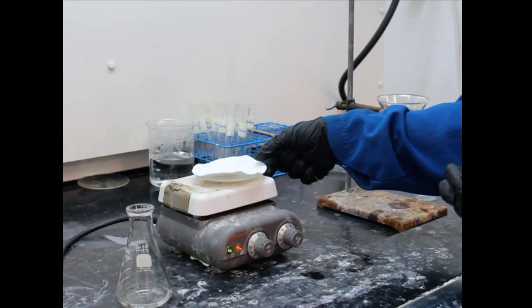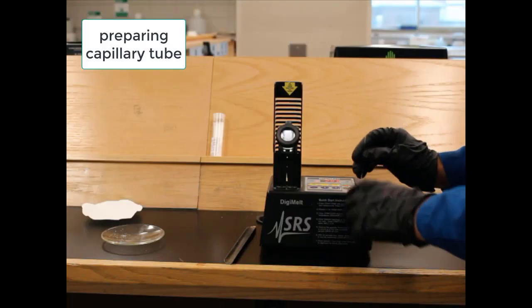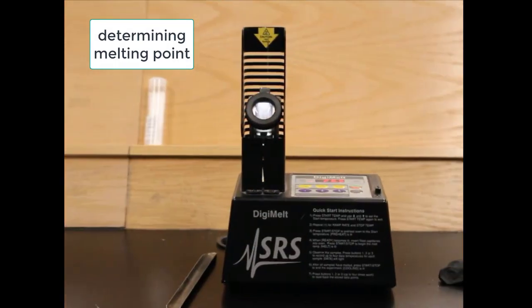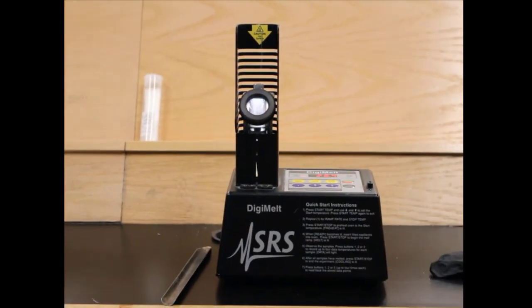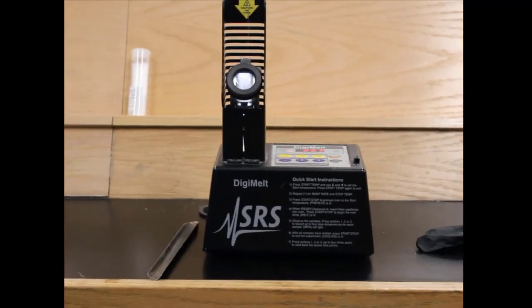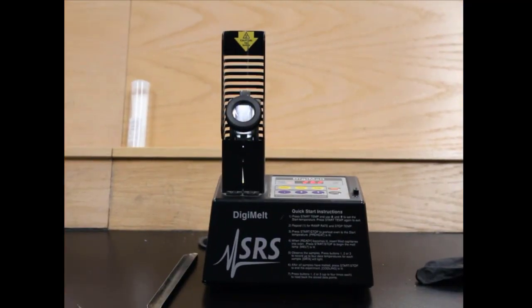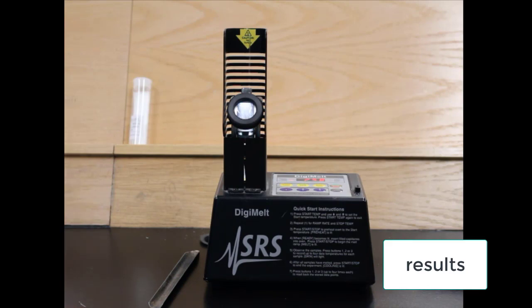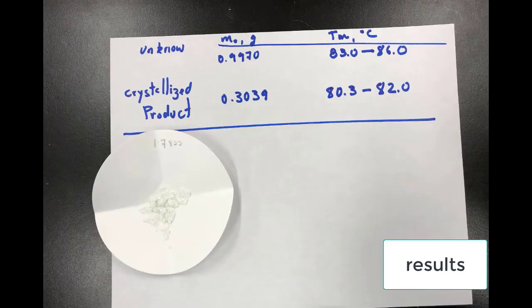No. All right, and so they checked it, and you can see how stiff it is, so it dried. Now they're going to check the melting point of their recrystallized unknown. Why would they do that? I don't know. That's very strange. I mean, it's not like that serves a purpose or anything. Anyway, we're not actually going to see the melting take place, but we can use that melting point to tell us what our unknown most likely was.